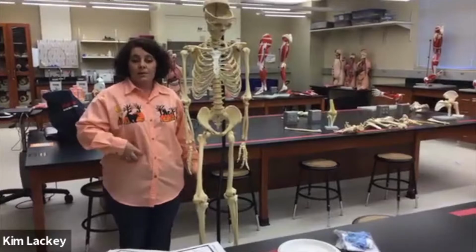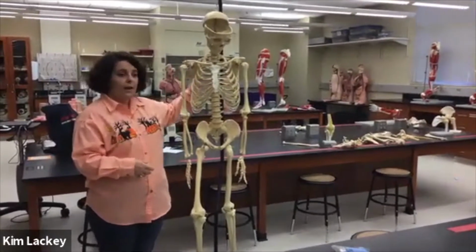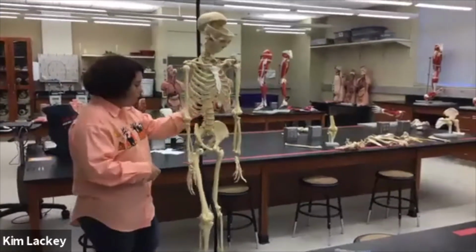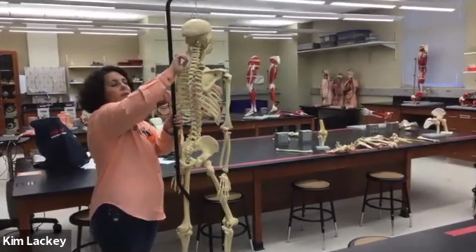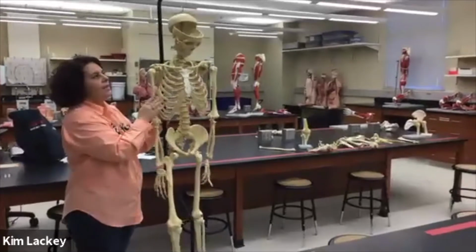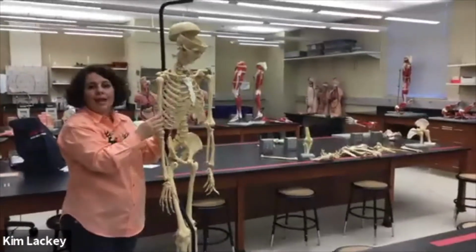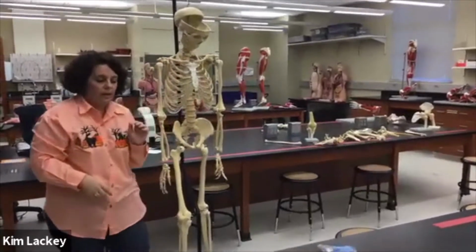You'll find sometimes some rib bones. That's not uncommon. We may find the scapula or the shoulder bones over here. We'll often find the skull, and in the skull, we'll often find the teeth still intact in there, okay? We'll find some jaw bones in it.